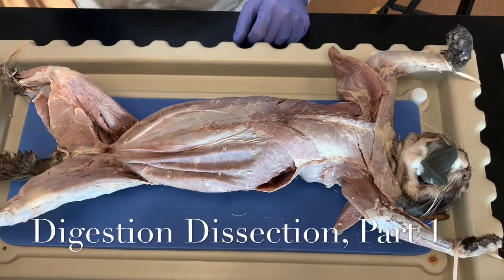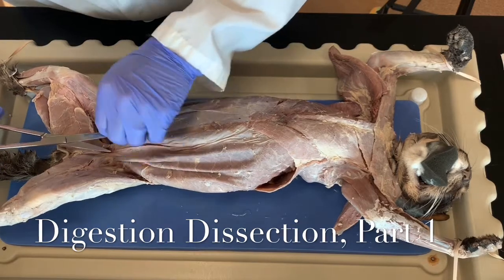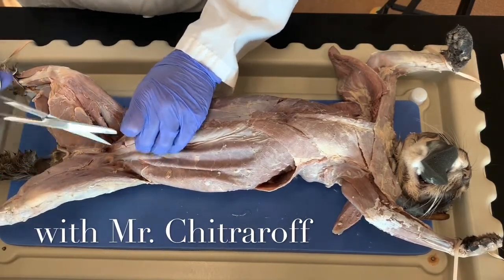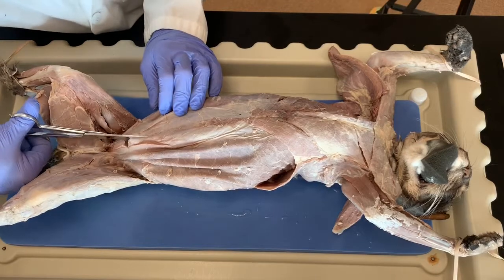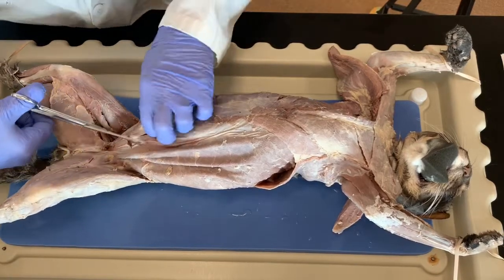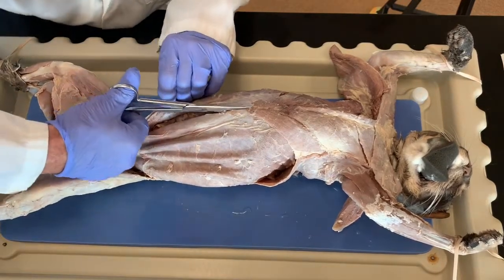All right, we're gonna start the incision on the posterior end. Again, we're gonna pull this up and make a little cross incision. And then we're gonna hook through the blunt side, and we're gonna do a mid-sagittal cut all the way up the abdominal cavity, lifting up as we go so we don't damage any of the tissue underneath. So there we go, up to the chest.